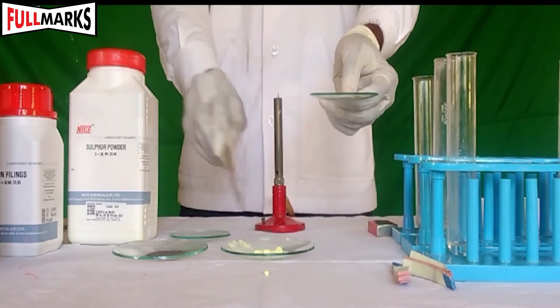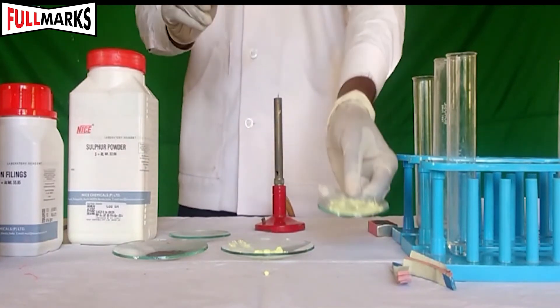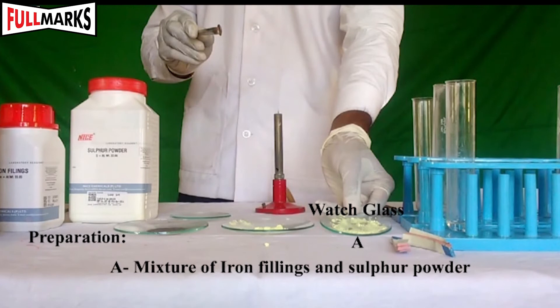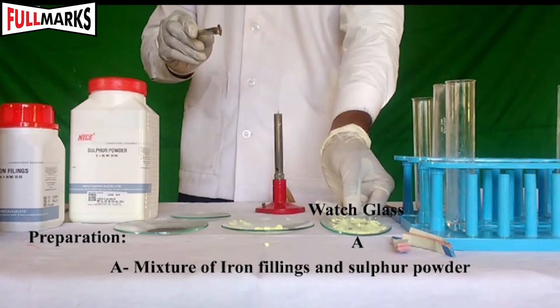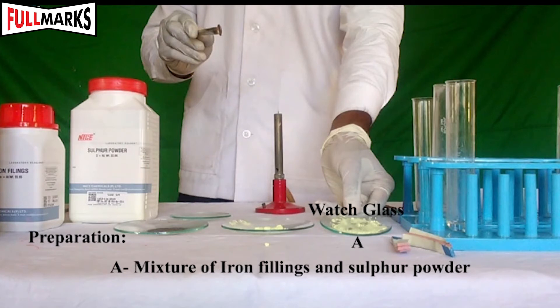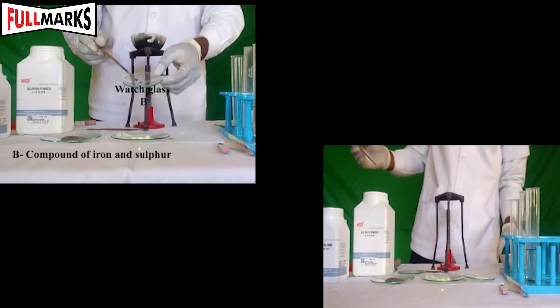Procedure — Preparation of a mixture of iron and sulfur: Take a pinch of iron filings and two pinches of sulfur powder. Mix them thoroughly. The product obtained is a mixture of iron and sulfur. Keep it in watch glass A.